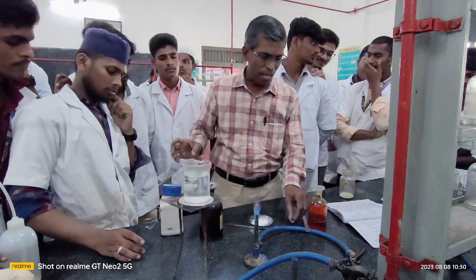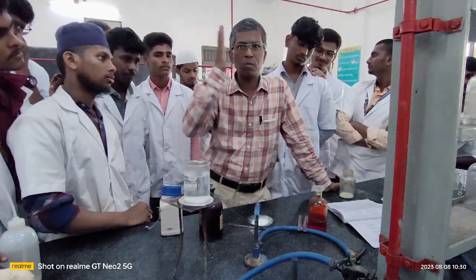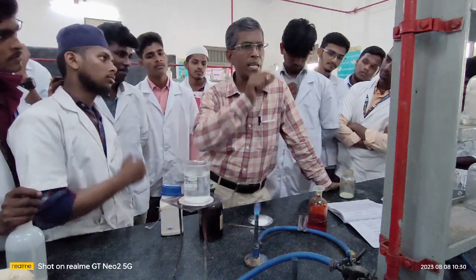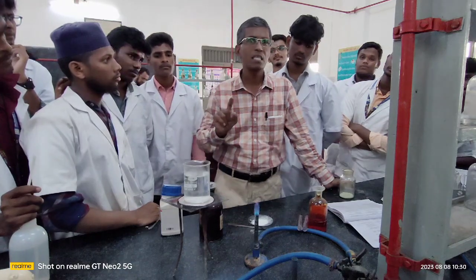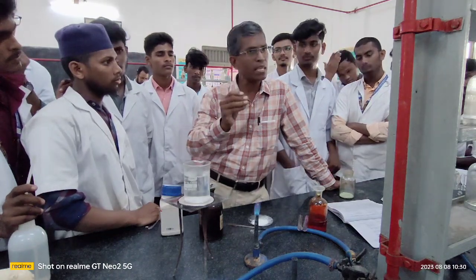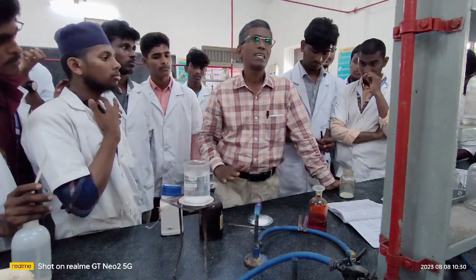This is unsaturation. Now I want to tell you one very important thing with respect to saturation and unsaturation. The inference at this moment is that one compound is saturated and the other given organic compound is unsaturated. Tell me, why is there a change in the color if the compound is unsaturated? What is the reason the color remains in the case of a saturated compound? Being a chemistry student, you should know why in some organic compounds the color of potassium permanganate disappears the moment we add it and shake, while some compounds keep the original color. What is the reason?